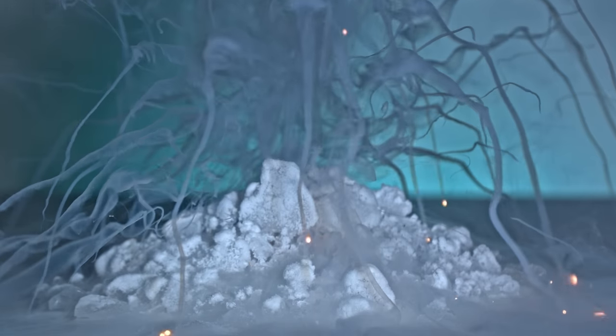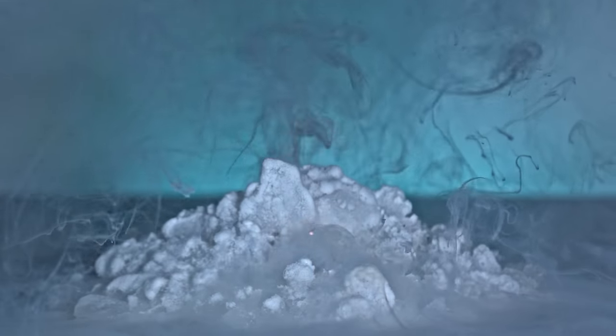The alloy ignites in air, and this is what will happen if we add it drop by drop to liquid oxygen.